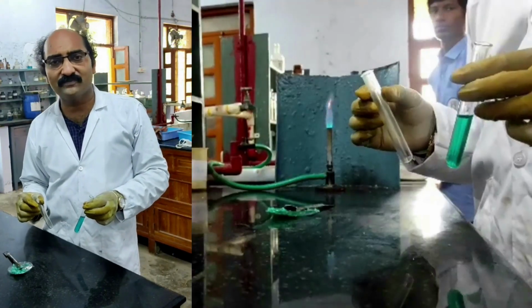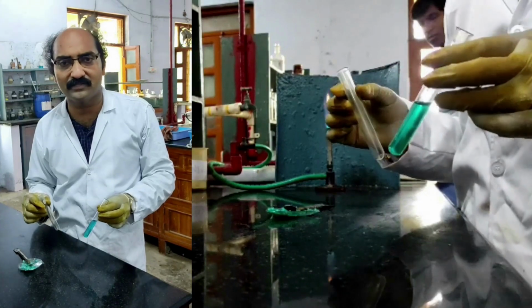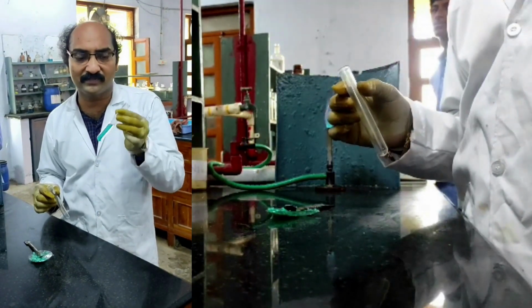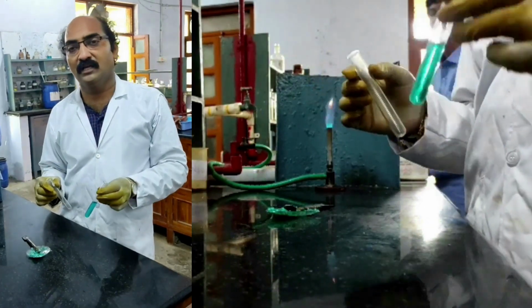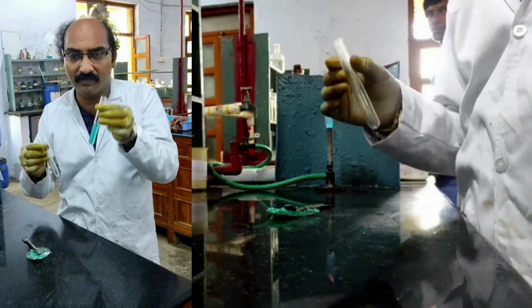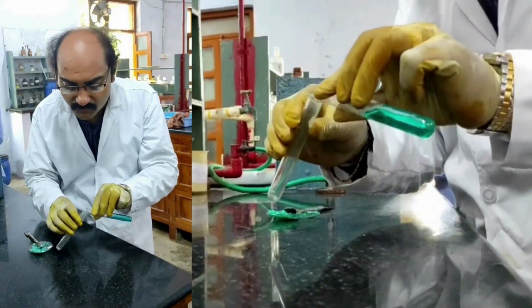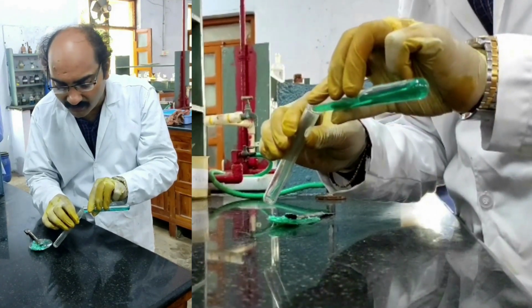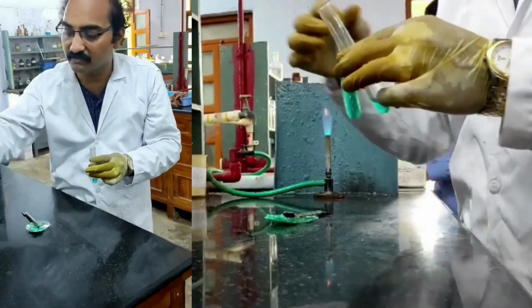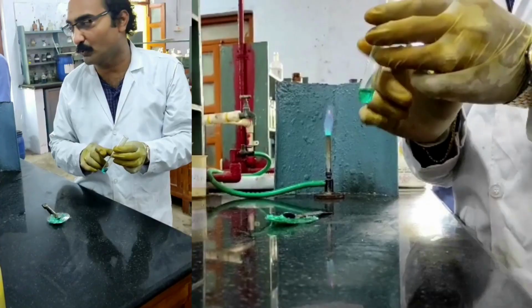The identification for sulfate: absence of all the remaining anions is the identification for the presence of sulfate. Now, therefore, let us confirm the presence of sulfate by doing a wet test. For that, I have taken sodium carbonate extract prepared by me into a fresh test tube. Okay, I have taken a small quantity. I am neutralizing this with dilute hydrochloric acid.